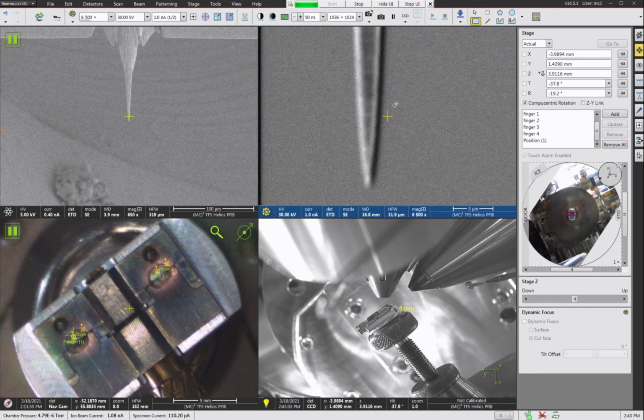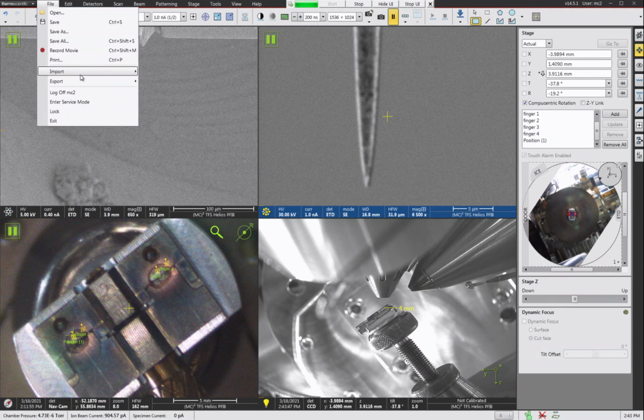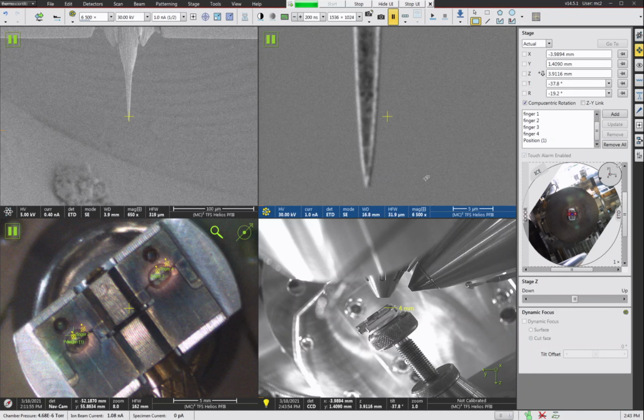All right, so we get our focus set up here. We got this sort of shadowy thing going on. That's when you're scanning really fast, you'll see that. Not really important, but that's what you're seeing here. And then my third pattern, I'm going to go ahead and import my pattern, third cut here at 1 nanoamp.